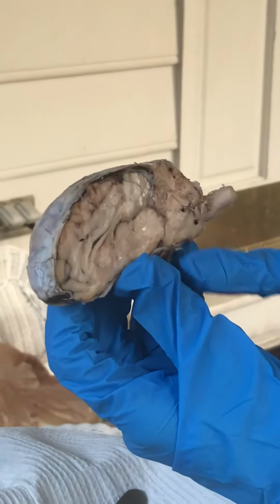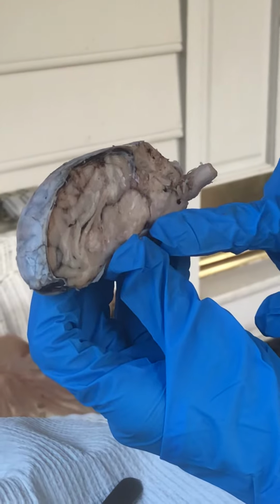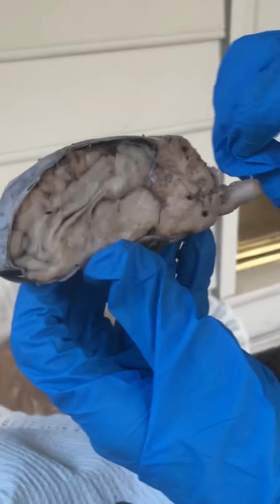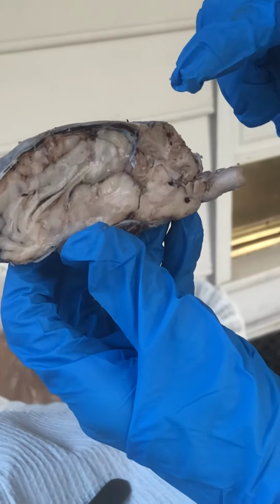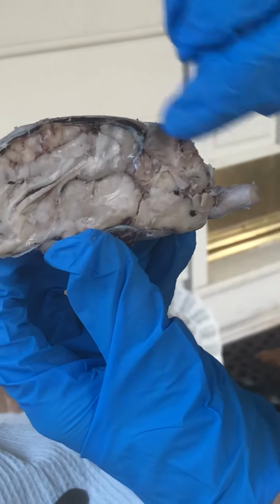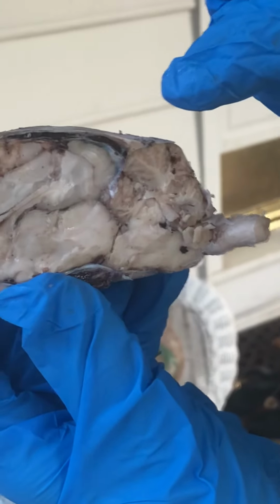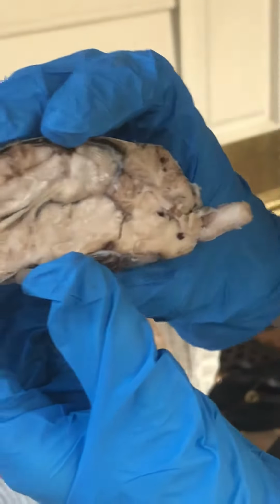And then moving towards the back of the brain, this is the medulla here, and in front of that is the pons. And then the arbor vitae is the gray and white matter of the cerebellum. And this is the cerebellum, as I said before. These little white lines are the white matter, and then the gray obviously would be the gray matter. And that is all.